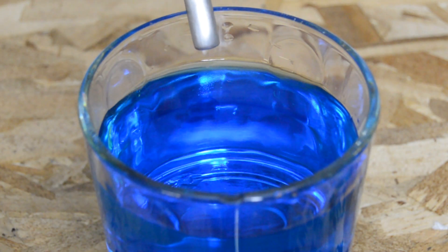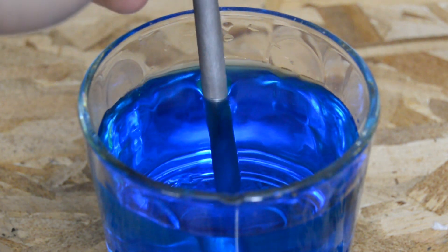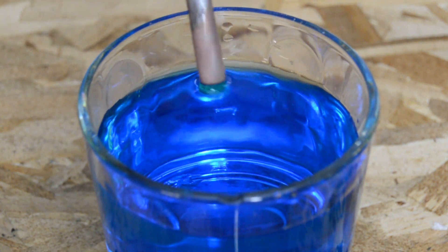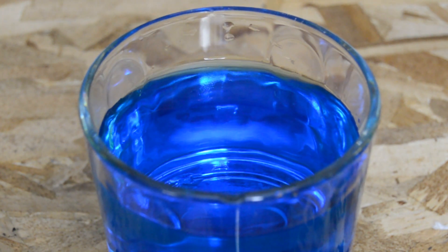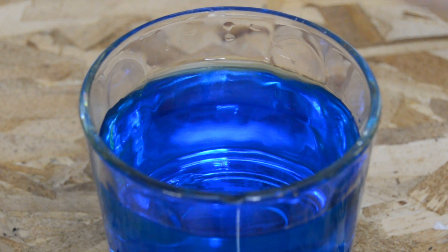Next, take an iron or steel rod and slowly insert the rod into the solution and then remove it slowly. You'll notice that the iron now has a sparkly copper appearance due to the deposition of copper on the surface through the displacement reaction.